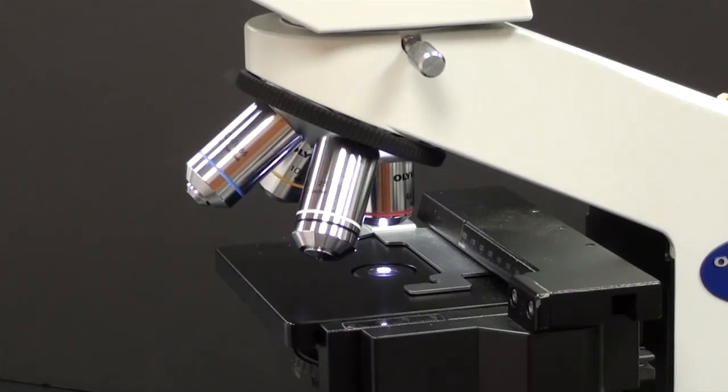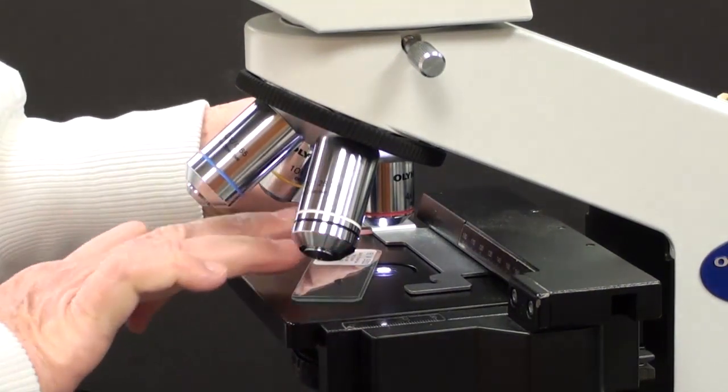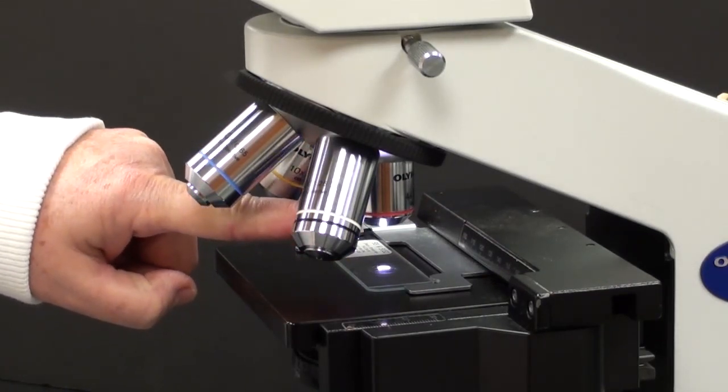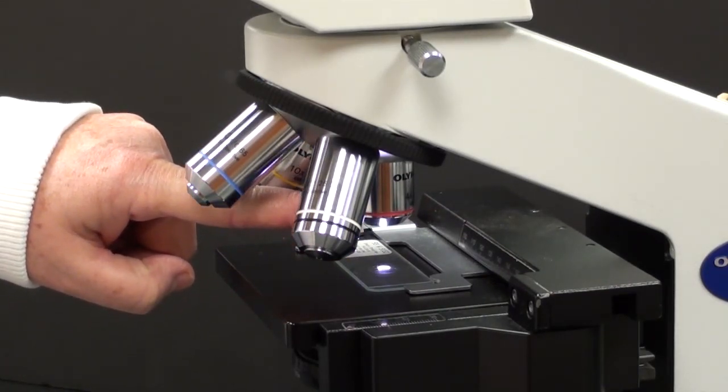I'm going to explain how to use a microscope, how to find what you're looking for on a specific slide. There are two secrets that I'll give you along the way. One is to begin using the scanning lens. That's the weakest lens. In this case, it's a 4x lens.